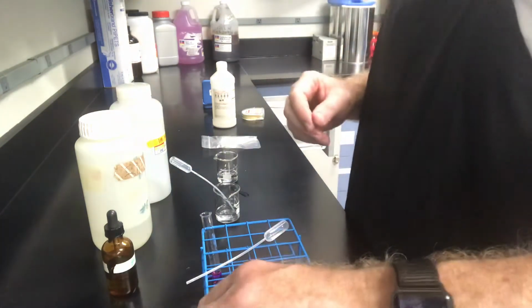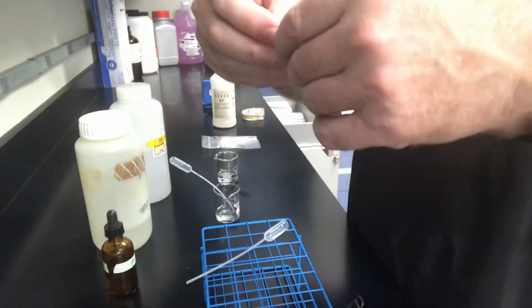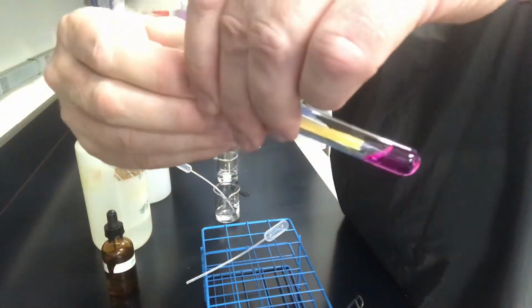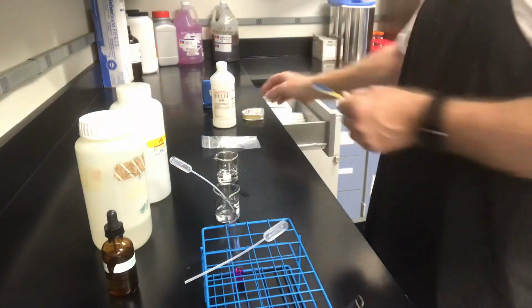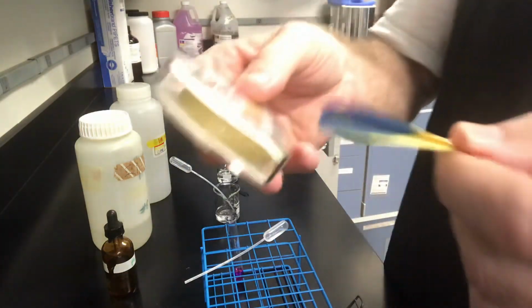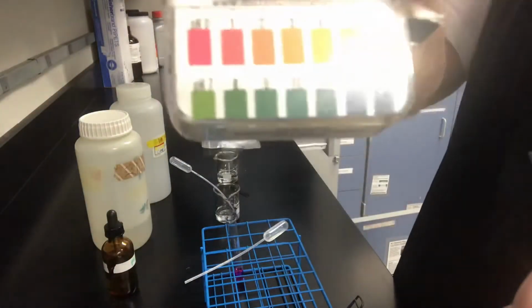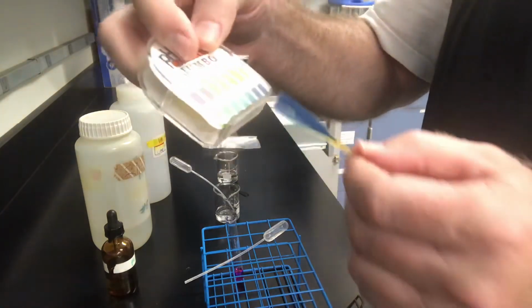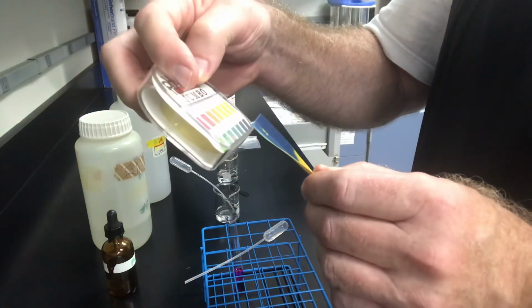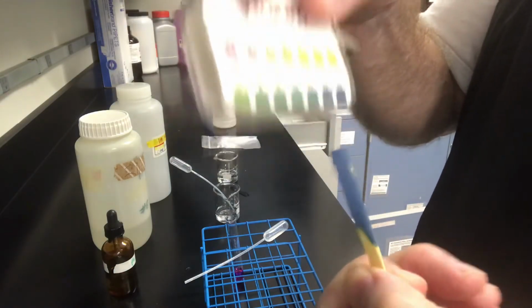All right, so we can get a pH reading on this one now and see what we come out with. And we'll just turn this to the side, saturate, get it nice and blue. And if you look at that comparison here, here's your color coordination chart, and here we got, right in here. I would call that, it's really tough to tell between 12 and 13. I'd go pH at 12 on that.